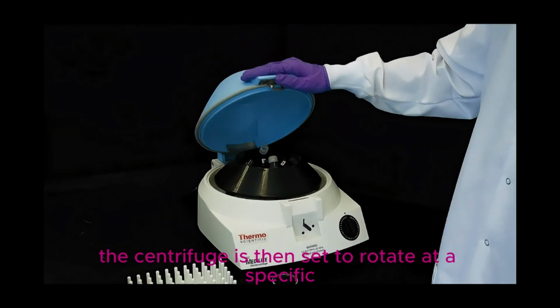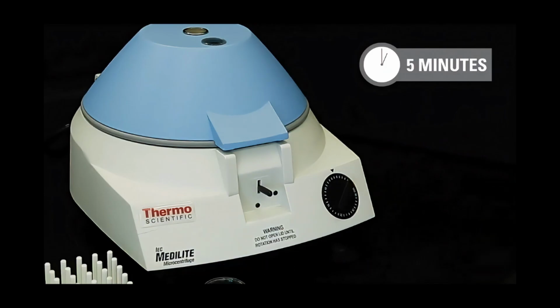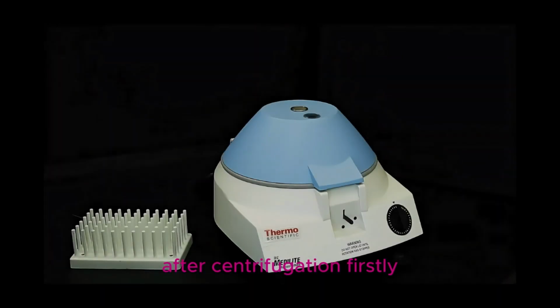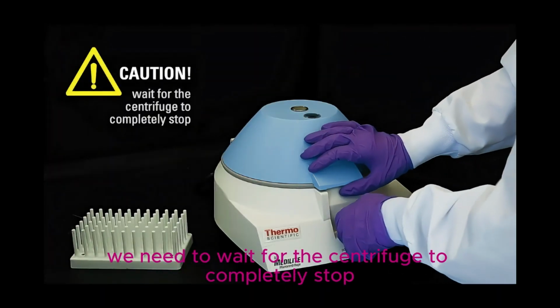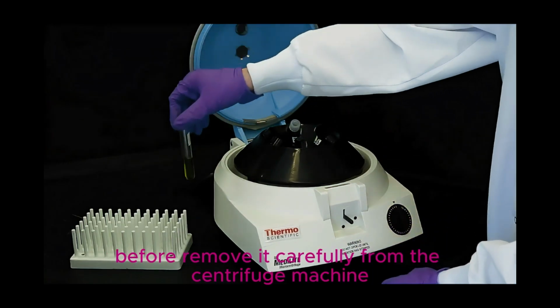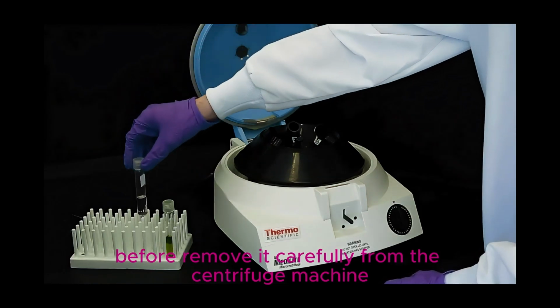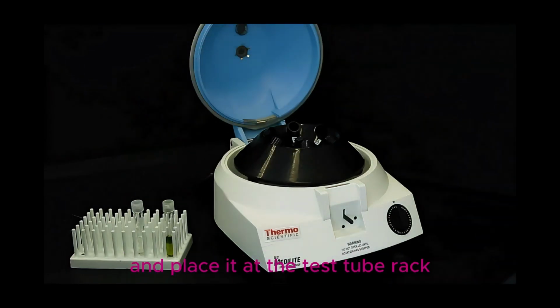The centrifuge is then set to rotate at a specific speed for 5 minutes. After centrifugation, firstly we need to wait for the centrifuge to completely stop before removing the tube carefully from the centrifuge machine and placing it in the test tube rack.